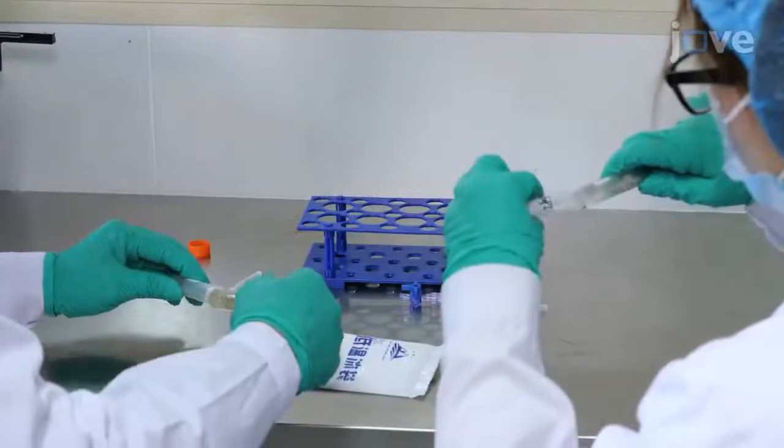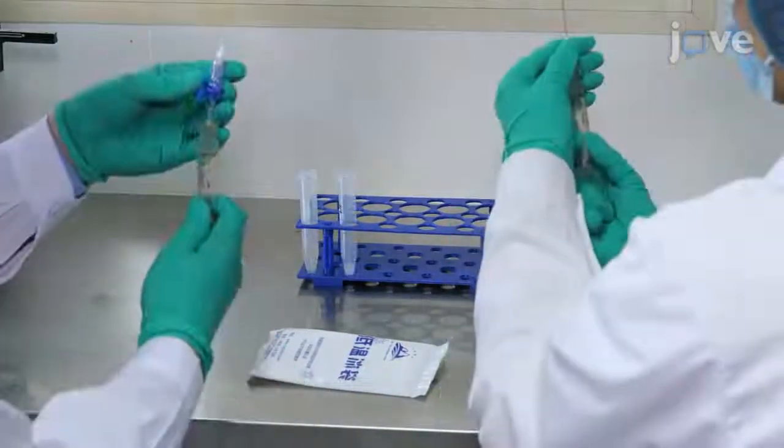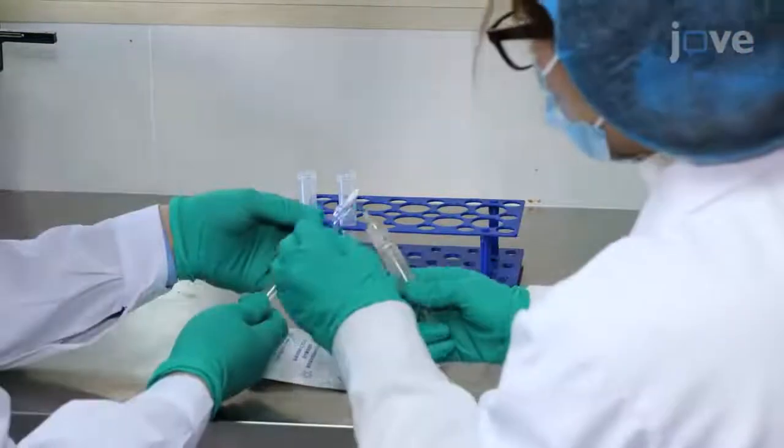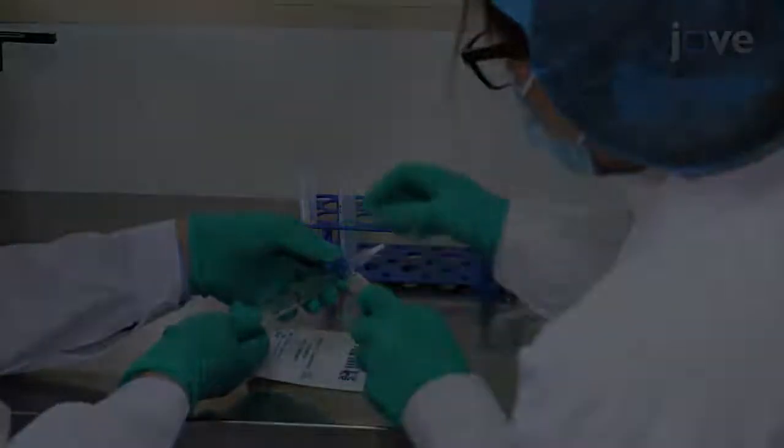Put the mixture of G6PI solution and complete Freund's adjuvant solution in an artificial emulsification unit with 2 glass syringes connected.